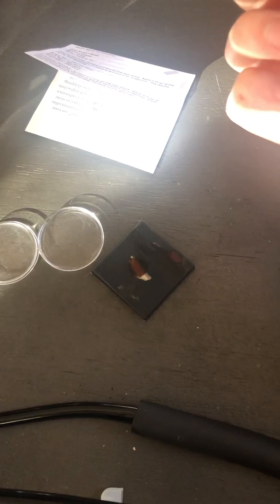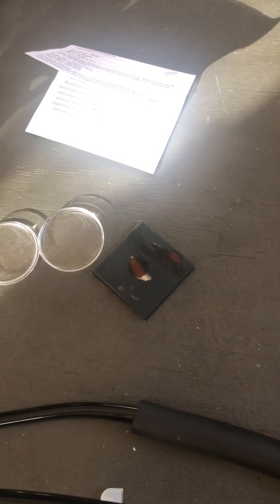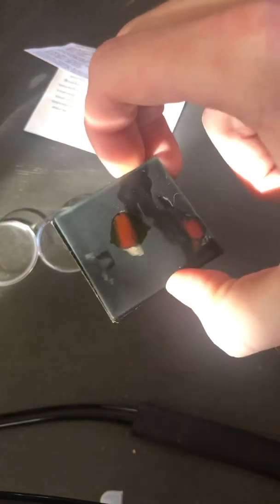So already it's definitely a red color, or at least an orange hue to it. It's red. It's not showing up so well on the camera, but it's definitely red. Yeah, so it does pass the check.